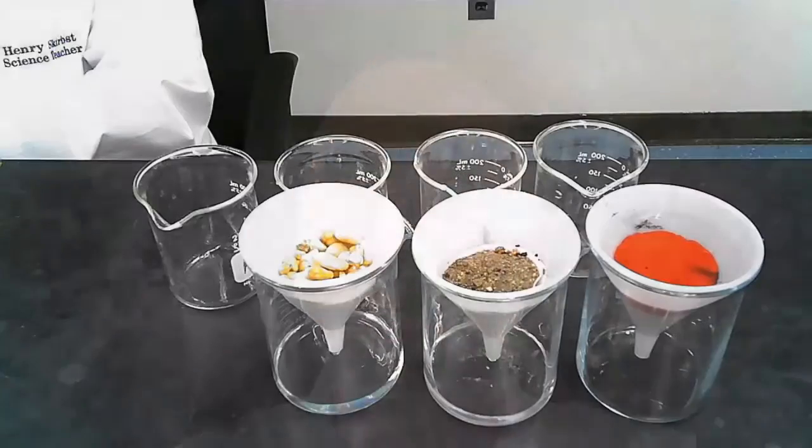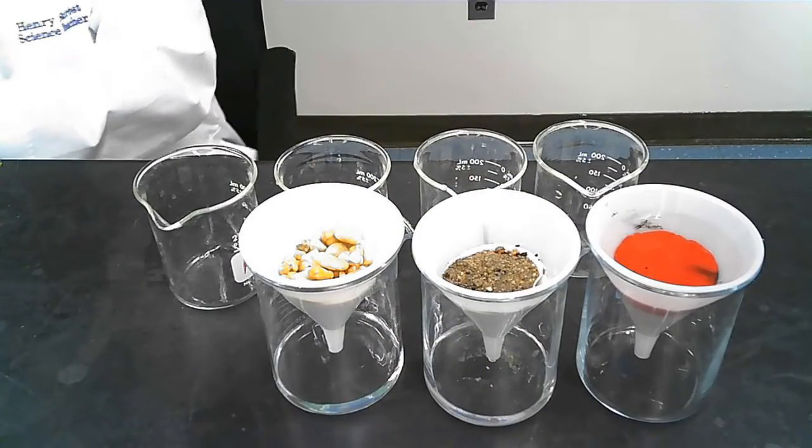And the problem of this lab activity reads, what percentage of the air we breathe contains oxygen? What percentage of the air we breathe contains oxygen? So come up with a hypothesis that percentage is. And while you're doing that, I'm going to go over to the lab view and set things up for the lab activity. So I'm going to move all of these items out of the way.